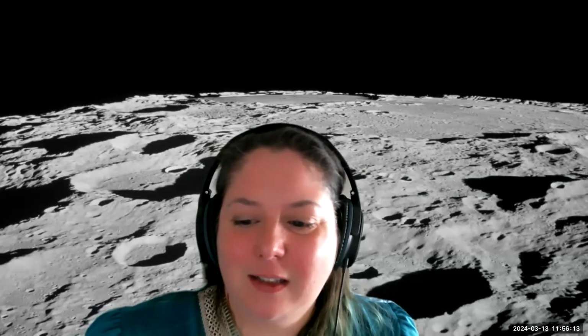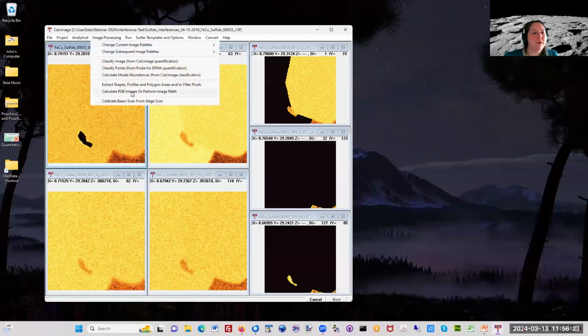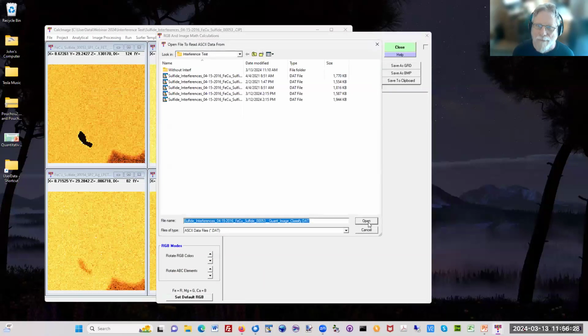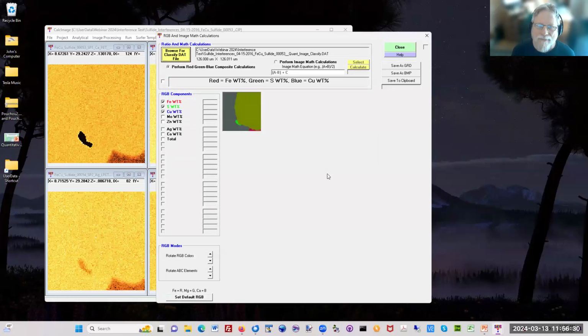Here's a question. Radek asks, can we calculate ratios in the maps? Yes. In fact, I can show this if I share my screen. It's just in CalcImage. Just like you can do map math on the JEOL interface. So here it is. This is not a great map for this, but you can assign colors for each of the elements.